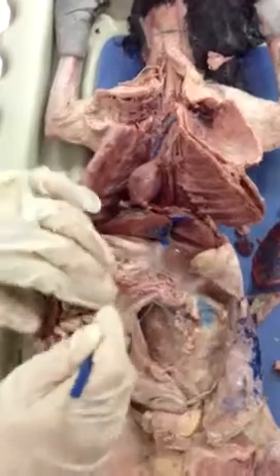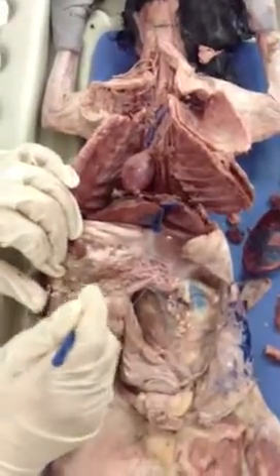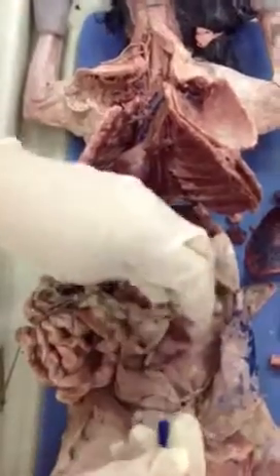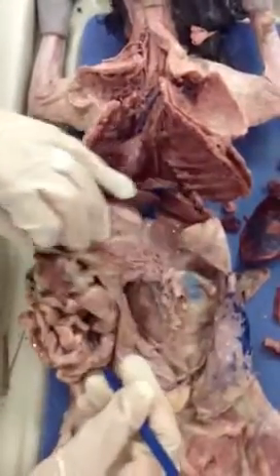Right. And the reason why it's going that way is because you lifted it that way? Yeah, exactly. It does the same thing on the other side? Yeah, I just shift it up so we can see it better.